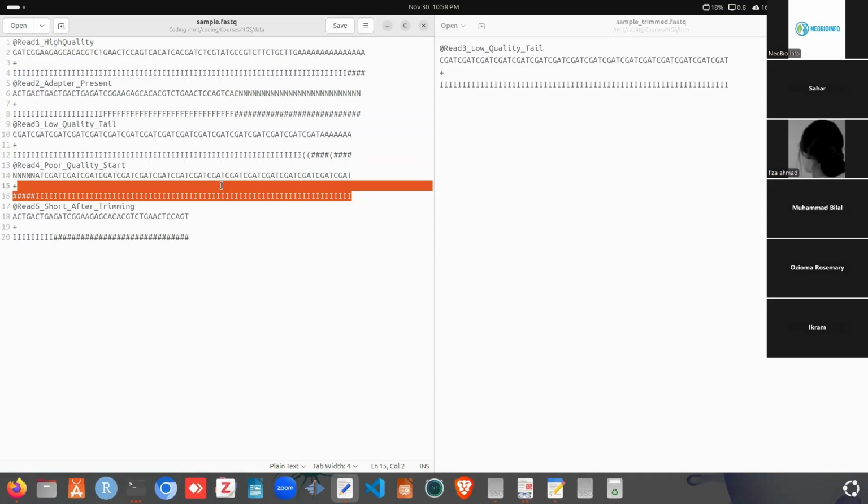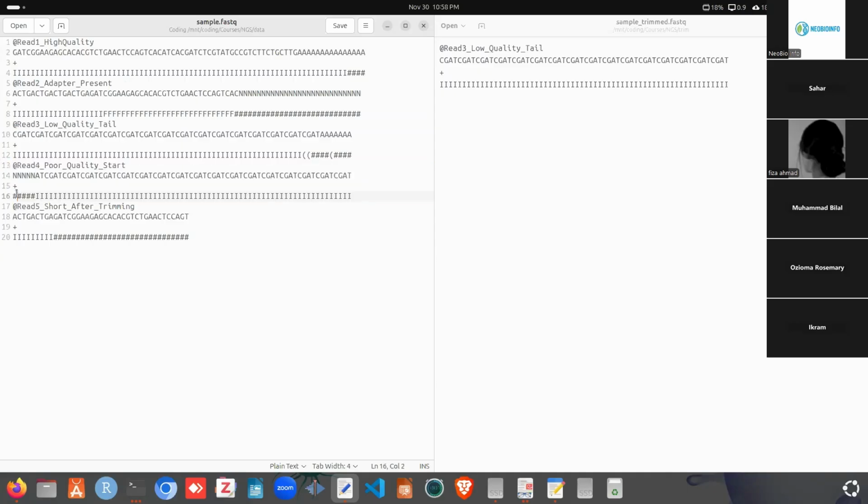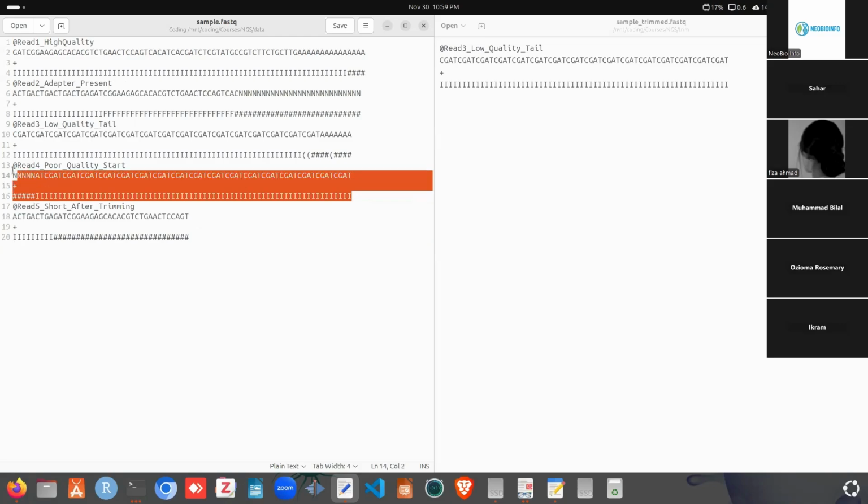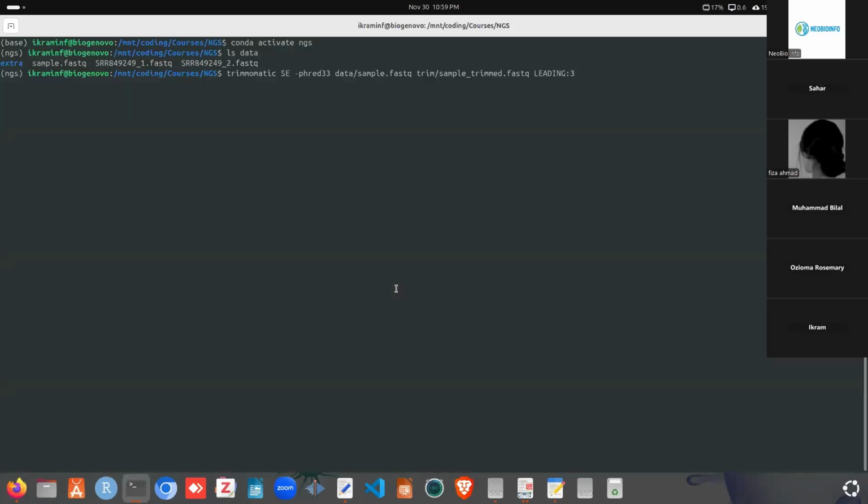For read 4, we can see for the first base we have a hash sign, which has the quality score 2. So it will be trimmed. After that, it proceeds to the next base, and that will be trimmed also. Then the next base, and the next one. After that, it found an I, which has the quality score 40, so the leading trim will stop here. For read 5, we don't see any effect, so it will be as it is. So we will only see the effect for read 4. Now let's run the command and check what we have.